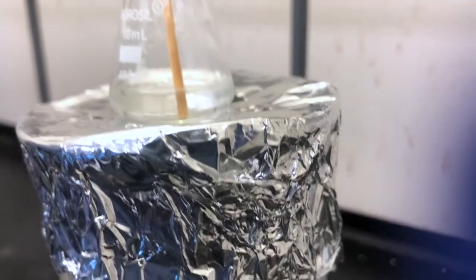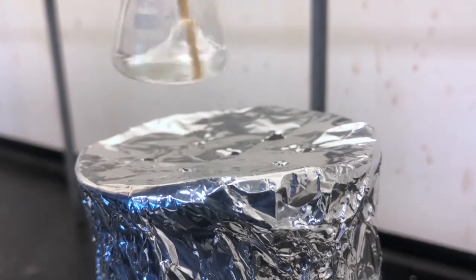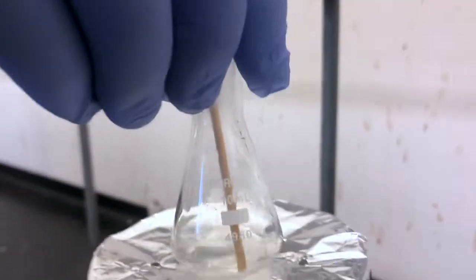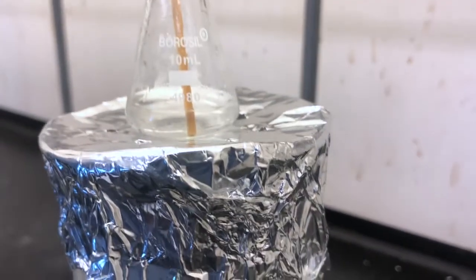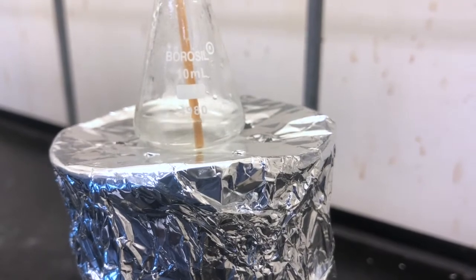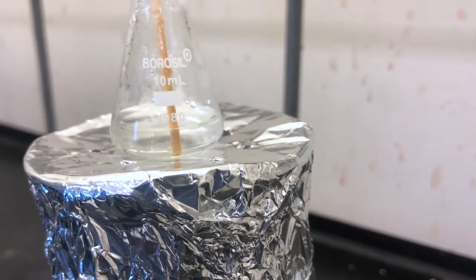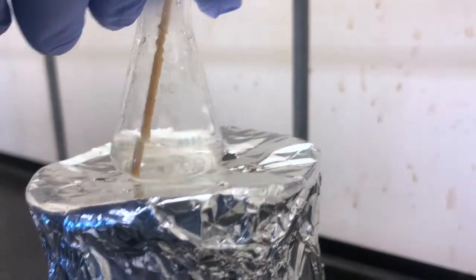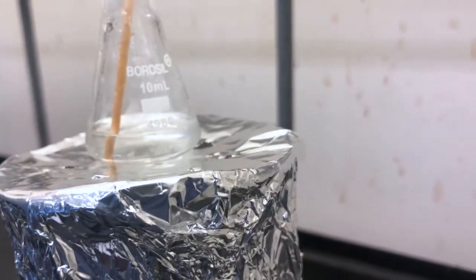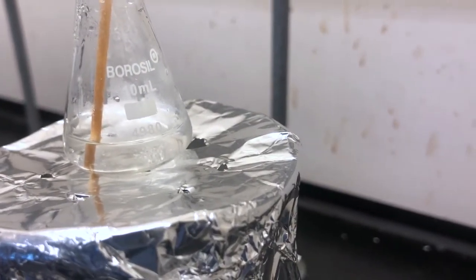Unfortunately, in this case, due to the error, I used the solvent in which the substance was most soluble, and so it's going to be very difficult to get this material to come back out of the solution. This particular recrystallization is almost always troublesome, and I didn't notice on the day that this was a problem, that I had used the wrong solvent. And now that I look back at the video, I realize this is the reason I couldn't get it to come out of solution after this. It's just a slight bit cloudy. Presumably, if I'd used the 1-to-1 ethanol water, I would have needed quite a bit more solvent to dissolve it, but it would have come back out of solution more easily.